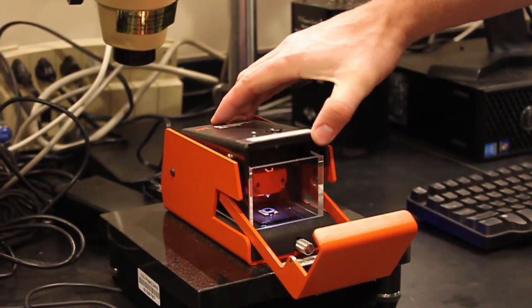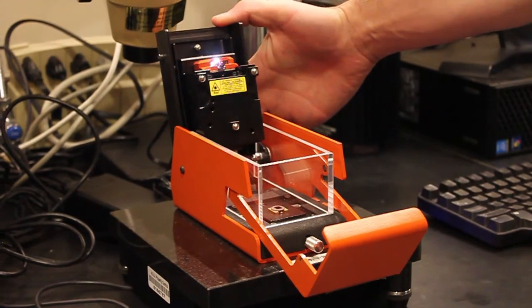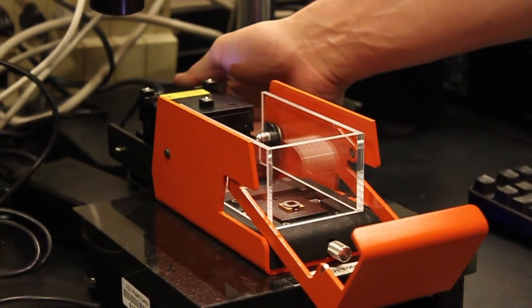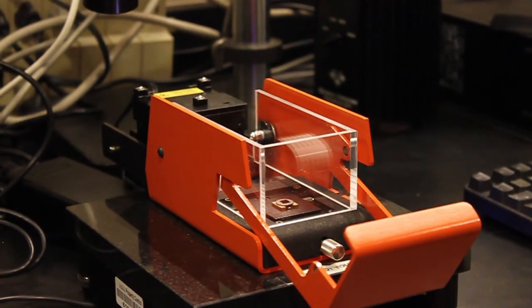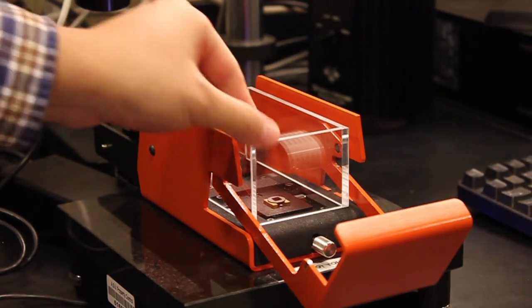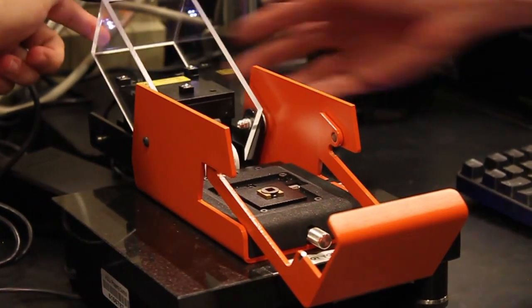How do you use it? A sample must be loaded into the chamber, and a probe must be carefully lowered to just above the surface. Too far away, and there won't be any measurements. Too close, and the probe tip could break. Once loaded, an appropriate scan speed must be chosen for your required accuracy.